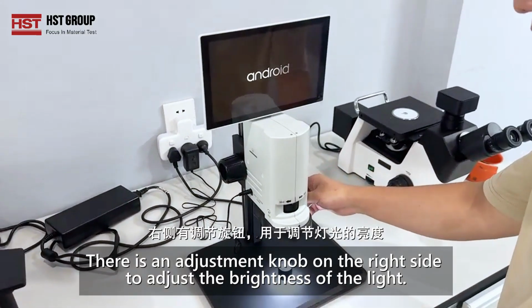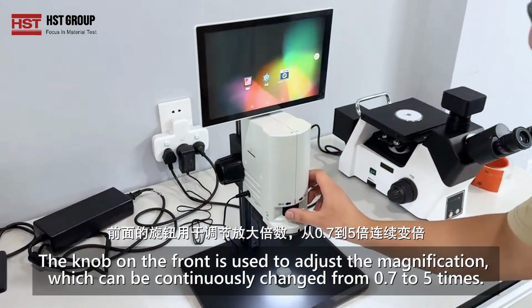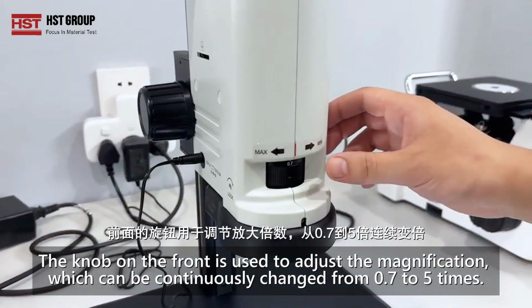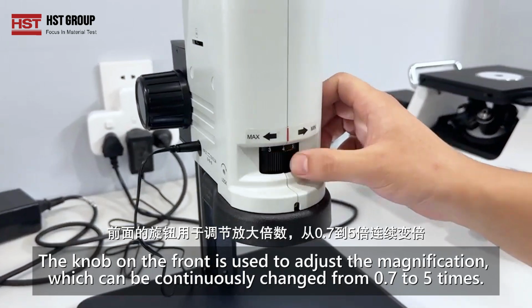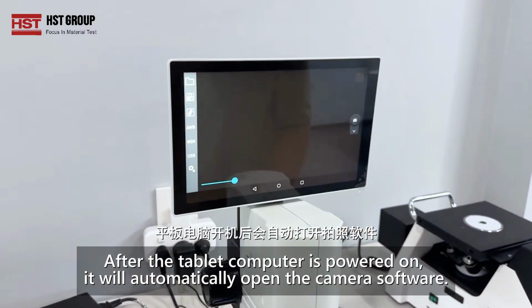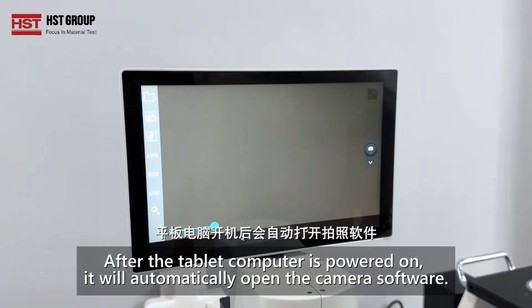There is an adjustment knob on the right side to adjust the brightness of the light. The knob on the front is used to adjust the magnification, which can be continuously changed from 0.7 to 5 times. After the tablet computer is powered on, it will automatically open the camera software.